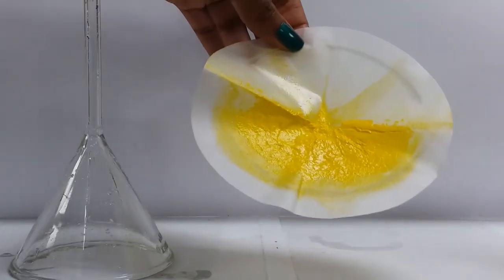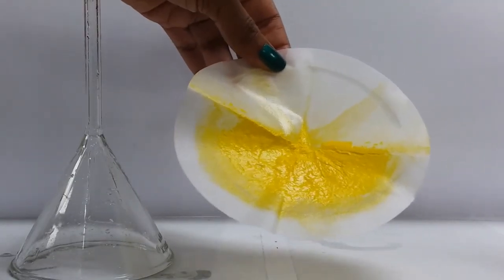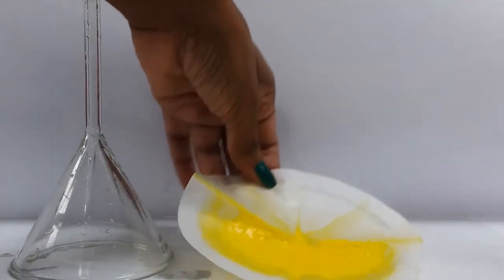So here we see our residue. Please note the appropriate colors.